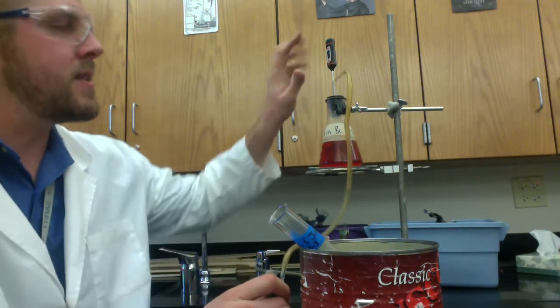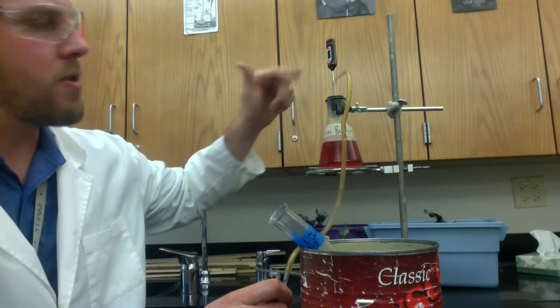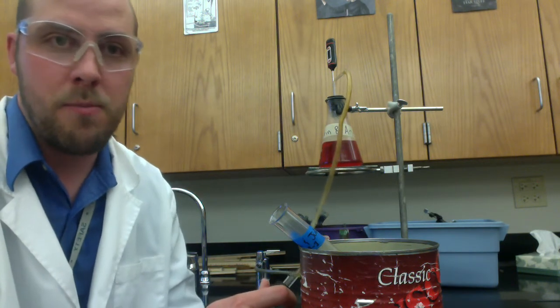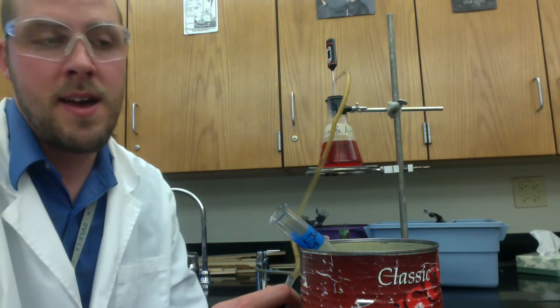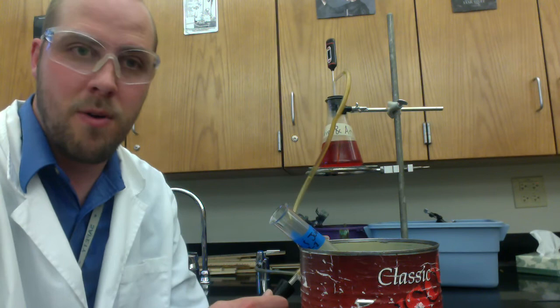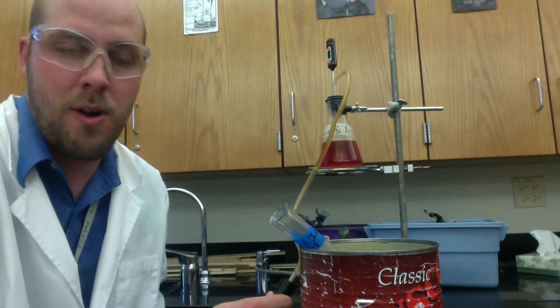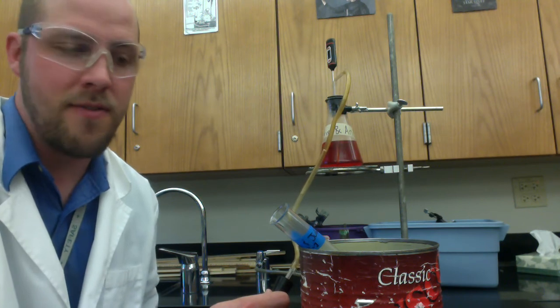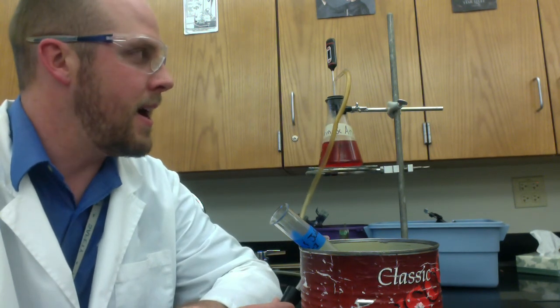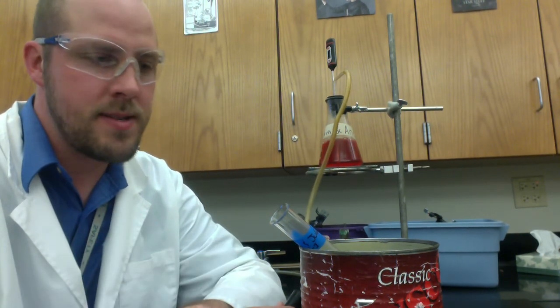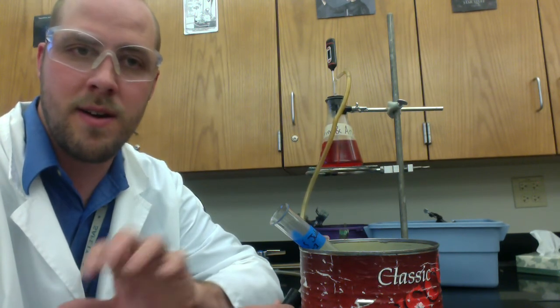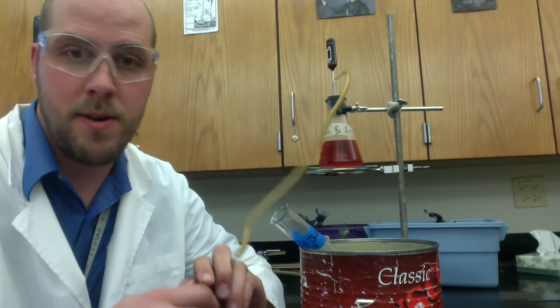The point you're looking for is when you're watching your thermometer, you're looking for when your thermometer starts to go above the boiling point of water. So above that 95 to 100 degrees Celsius. Once it goes above that, you know that you're not boiling water anymore. You're pretty much done with water and now you're starting to boil that sugar. That's the point where you want to turn that off. And I'm going to have you try to harvest that sugar actually by pouring it into another container. We'll let that cool and see what happens with that the week after when we come back. But that's basically what a distillation is, is separating components of a liquid into their various parts based on different boiling points. I hope you have a great week.